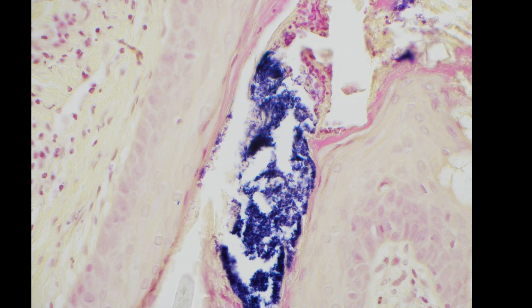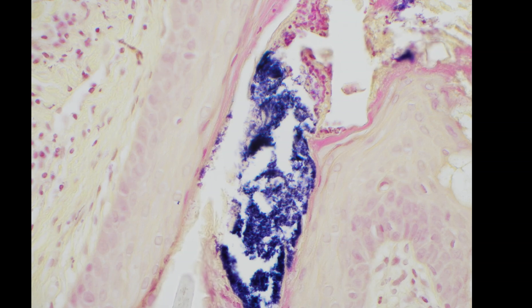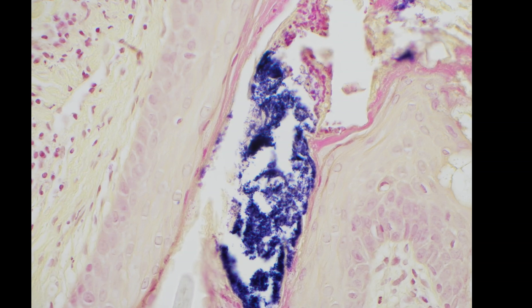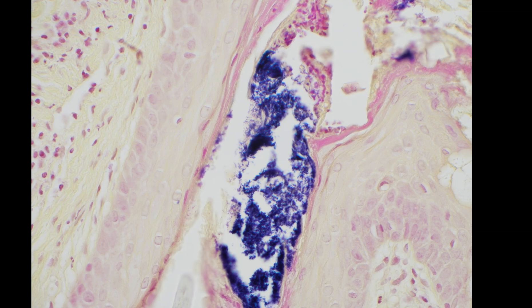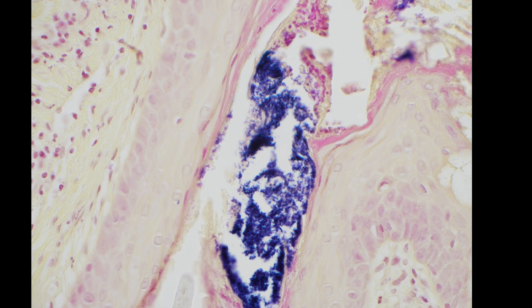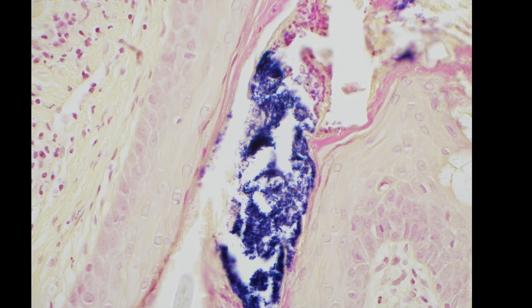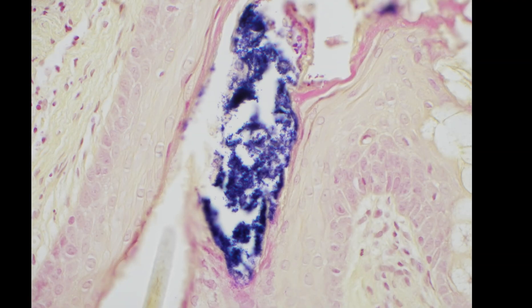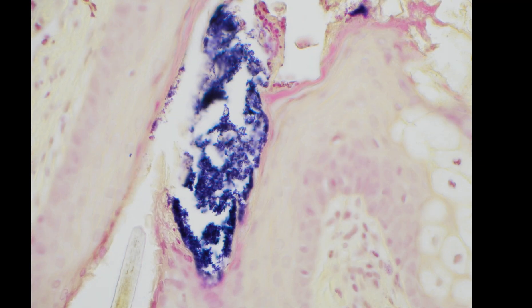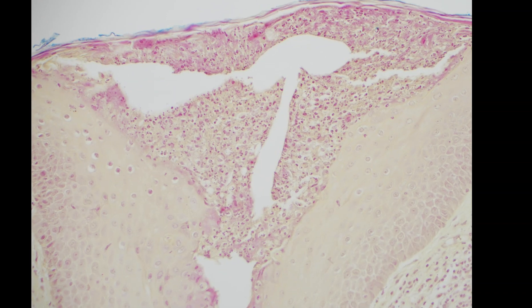But the reason we did this was not for any of that — I'm just easily distracted. This is because the bacteria turn this bright blue color on the gram stain, so those are gram positive cocci. I know you might say you can't see the little dots; that's just because my scope with this camera — I can see them better on my scope than you can on the camera view. In any case, that's a nice example of bacteria in a follicle with neutrophils — bacterial folliculitis. I had also done a fungal stain to make sure it wasn't fungus, and that was negative.